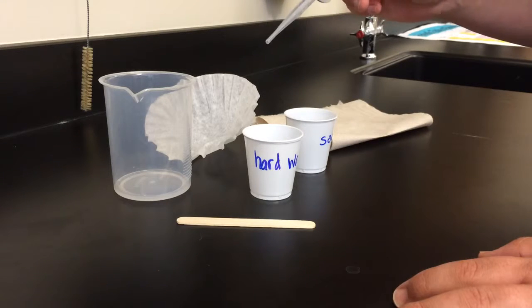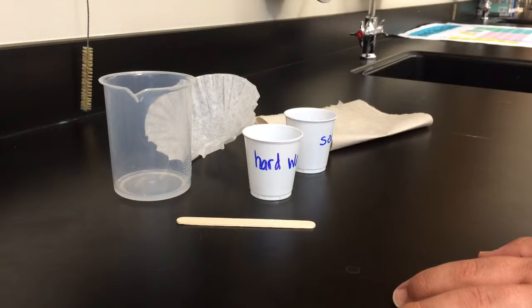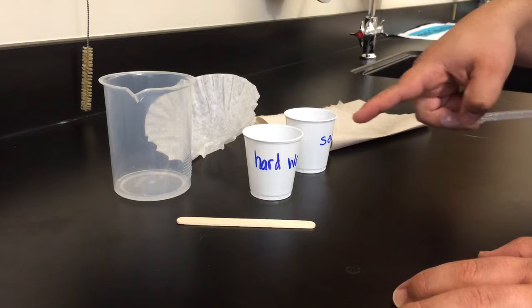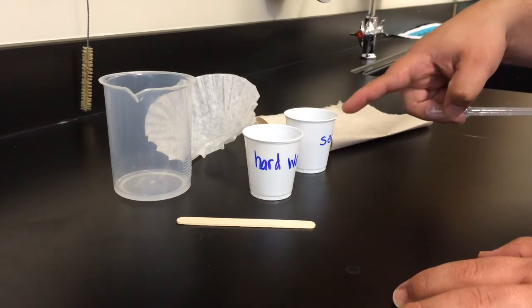So you start with one of these eyedropper pipette things and what I'd recommend is go to the bottom of the soapy water container to draw your soap because the soapy pieces, the pieces of soap, will stick to the surface, they float.